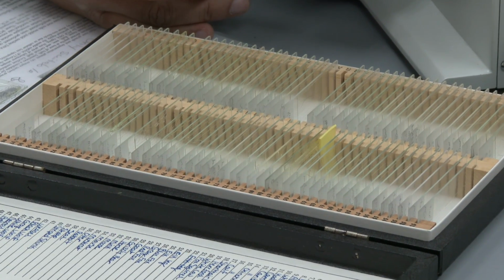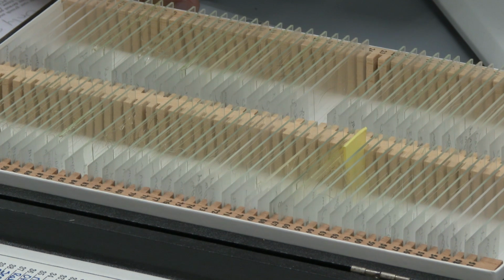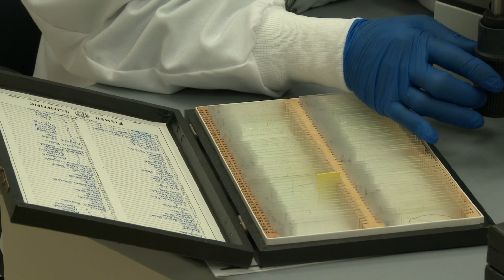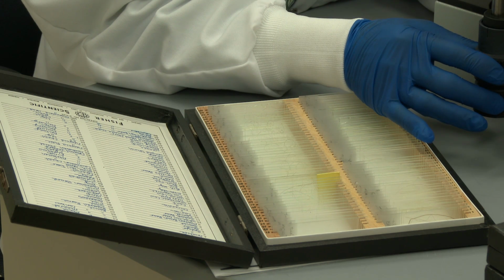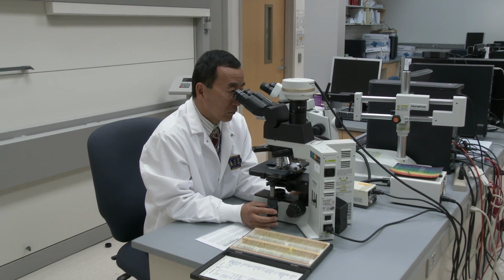And what we would then do is get known pubic hair standards from the suspect, known pubic hair standards from the victim, and compare those standard hairs against the questioned hair that was found in the victim's pubic combings and determine whether or not we could make an association, a disassociation, or basically an inconclusive. And if an association was made, the DCI criminalist had to determine the significance of the association as taught to the DCI criminalist by the FBI Crime Lab.